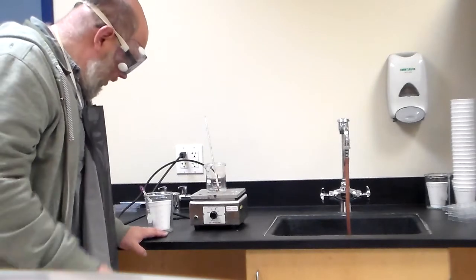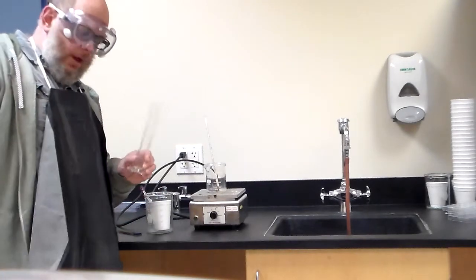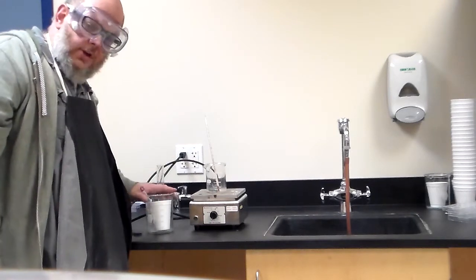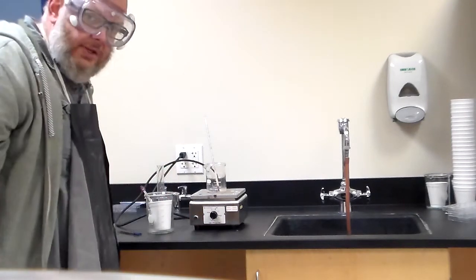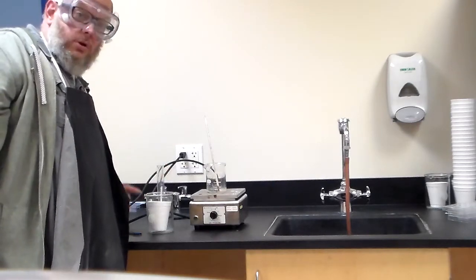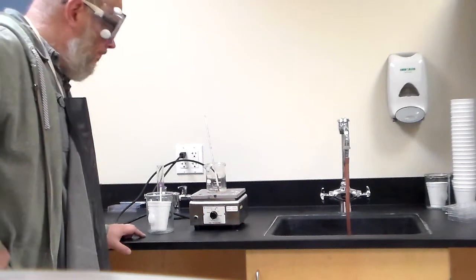What you're going to be doing is you're going to put in, again, a certain amount of water in here, which is why you use this. You do not boil this, you do not heat this up. You can get the water from the tap, that's not a big deal. But this thermometer needs to be in there, and you want to make sure you record your initial temperature.